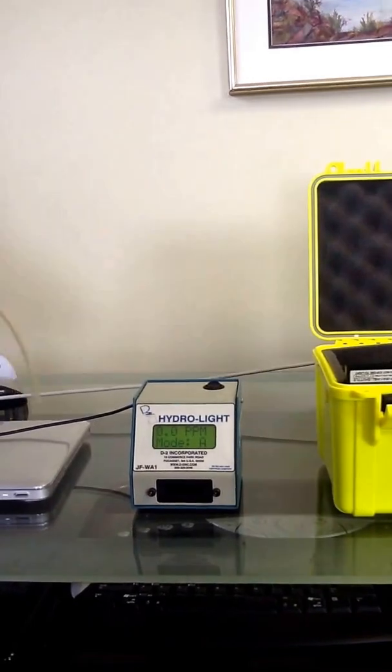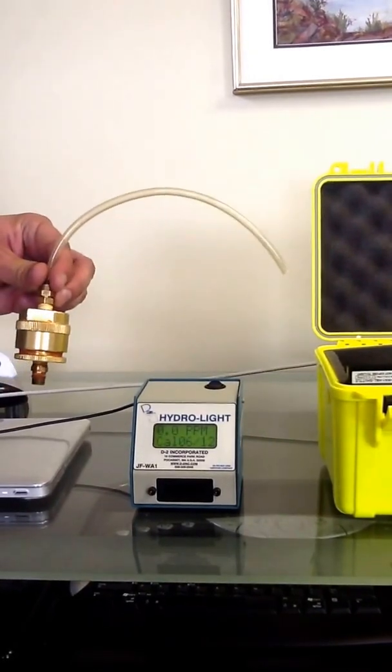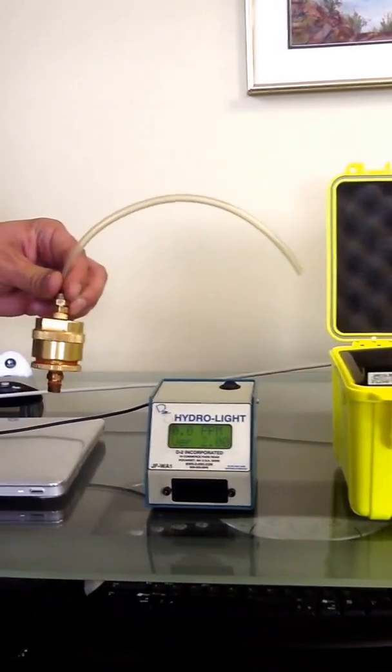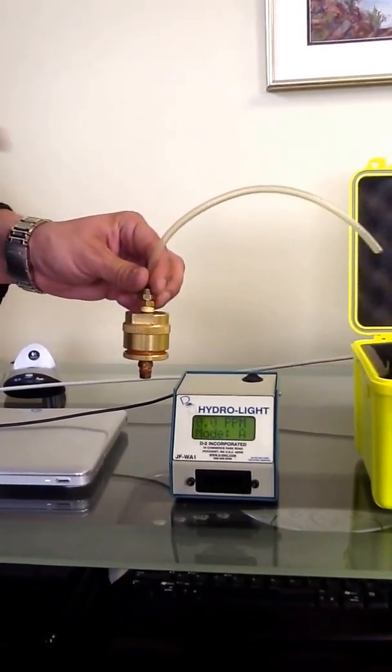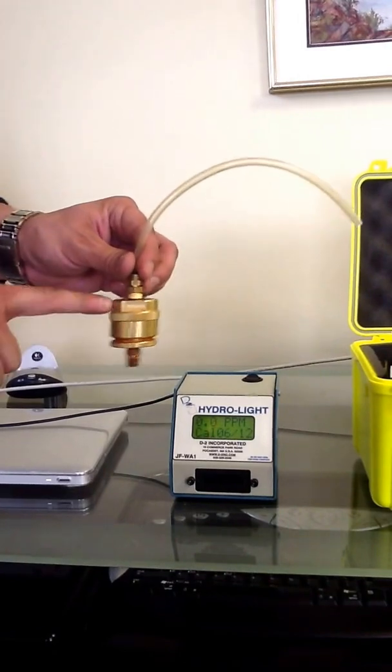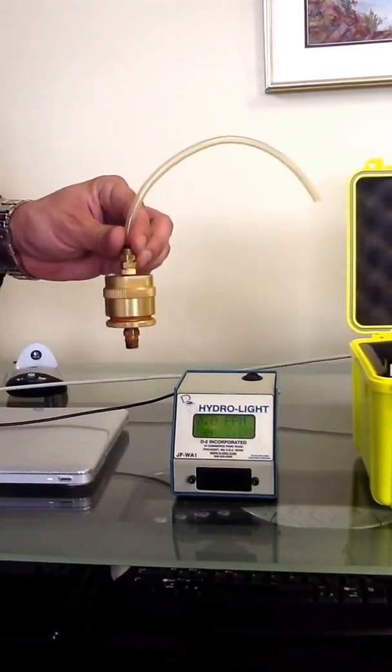In order to make a test pad, according to ASTM D3240, we're going to use the sampling apparatus, which is the standard apparatus for running a test pad. To make one, you run 500 milliliters of fuel down into the apparatus, which is holding a test pad.